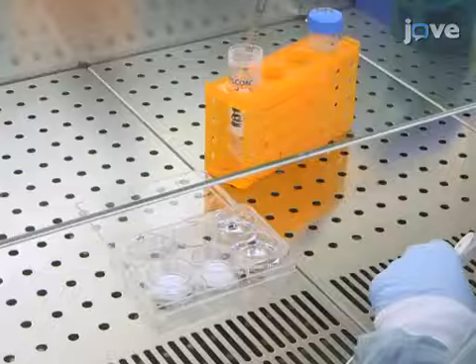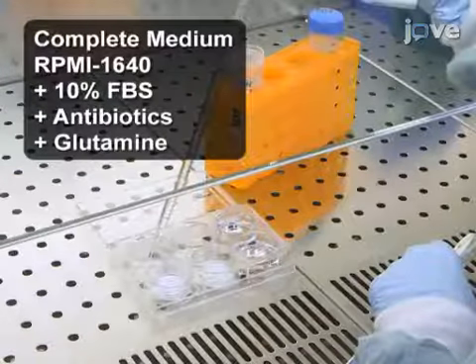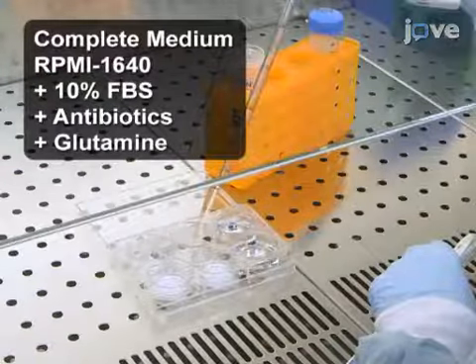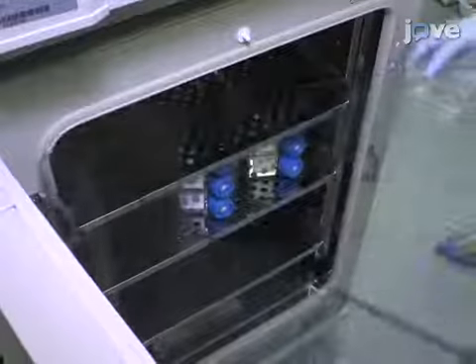In the tissue culture hood, add 1.1 milliliters of complete RPMI 1640 medium into each well of a 6-well cell culture plate. Then, using a pair of sterile forceps, place a sterile 30 mm cell culture insert into each well. Incubate the plate at 37 degrees Celsius for 30 minutes until later use.